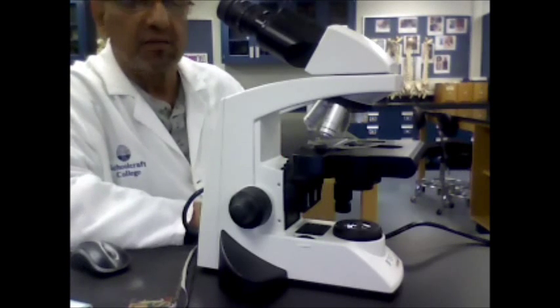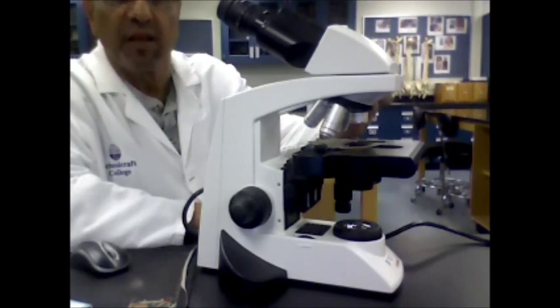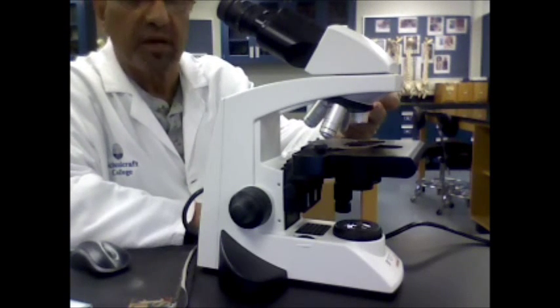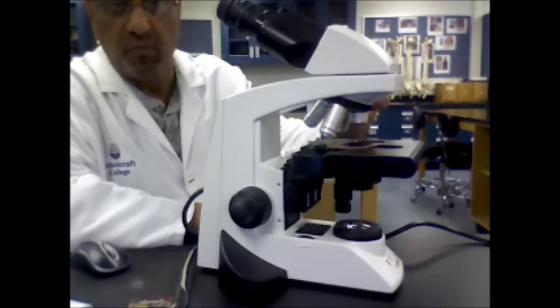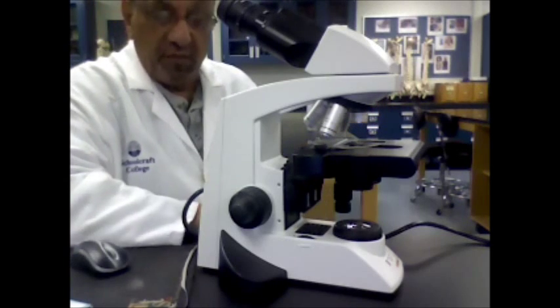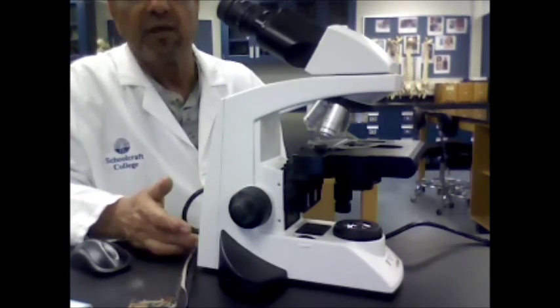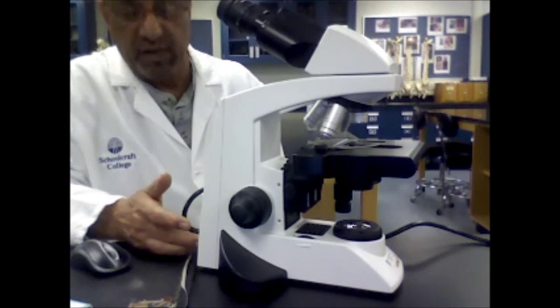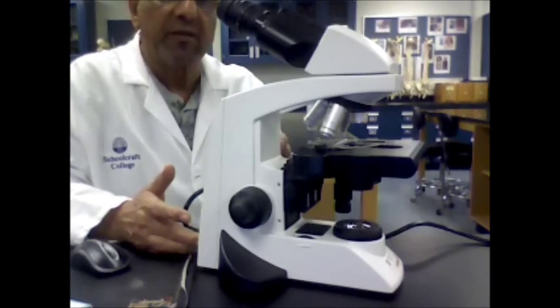We normally start by setting the objective at the lowest level. You can do that by either setting it at the scanner or at the low power. Then you're going to turn the light on — there is a little switch on the back of the microscope that will turn the light on.